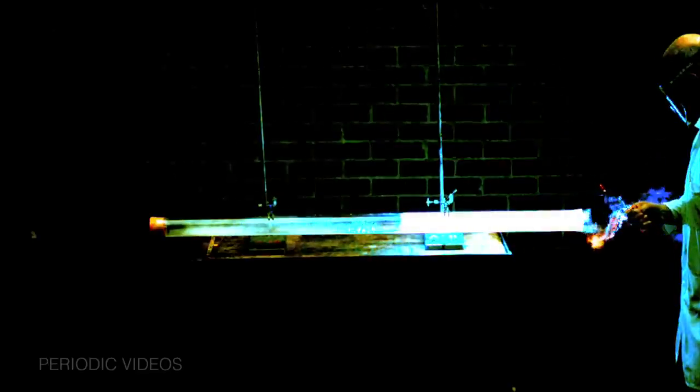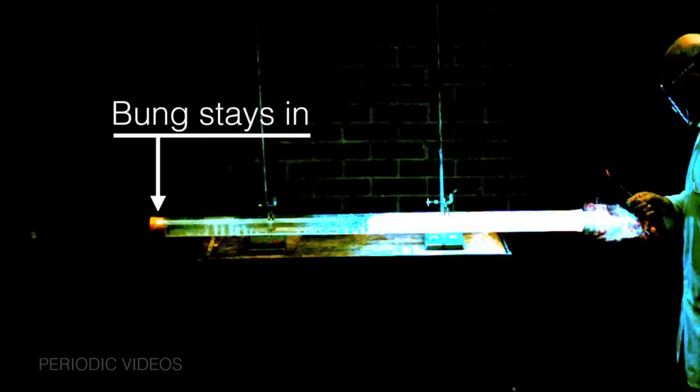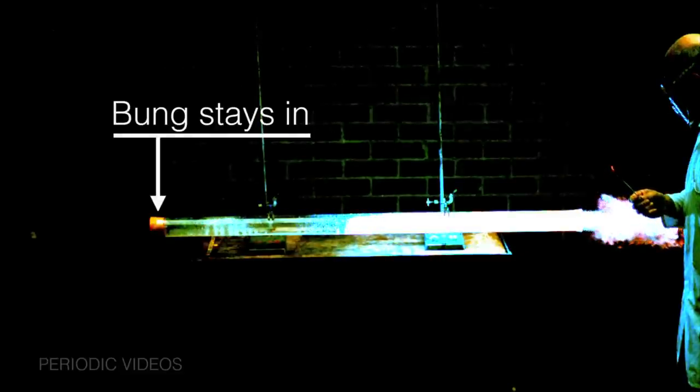As before, the flame started bouncing, but if there was a shockwave, it wasn't enough to remove the bung. And if you think about it, it's really quite a heavy bung. And Neil, being a tough guy, had pushed it in quite hard.